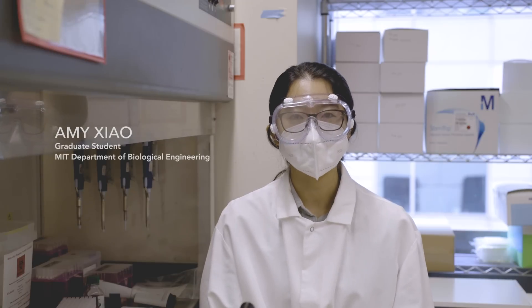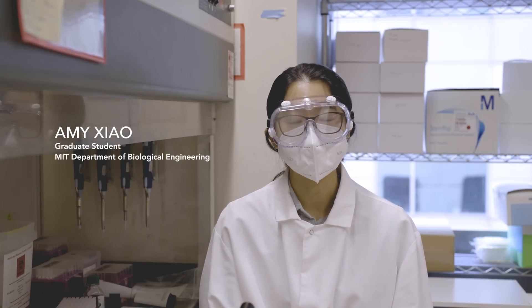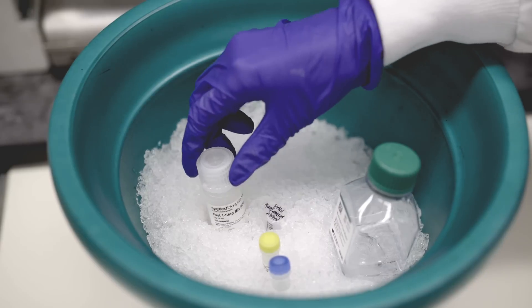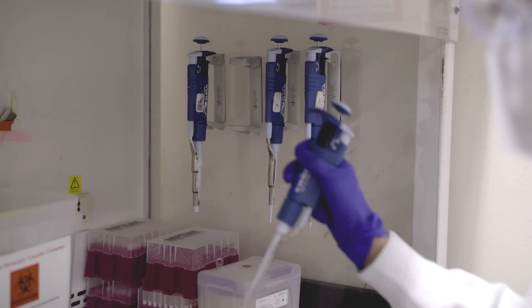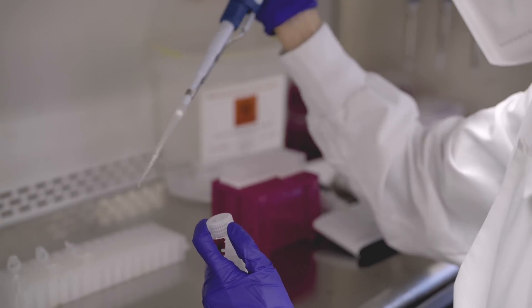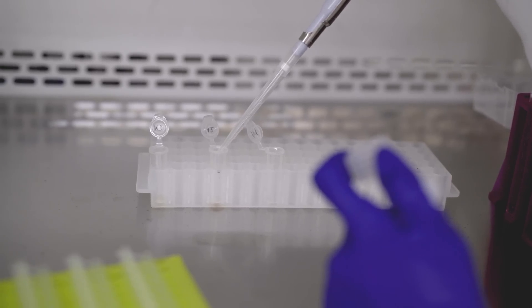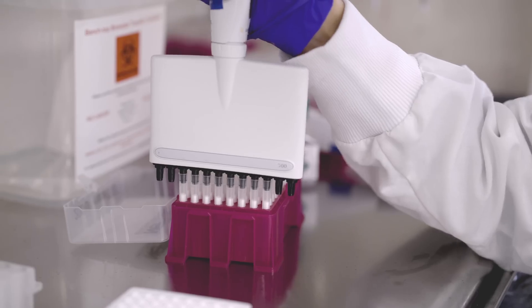The first thing we do is inactivate the wastewater to make sure that everyone in the lab is safe. Next, we enrich for the viral particles inside the wastewater and then we break the viral particles open to get their RNA.